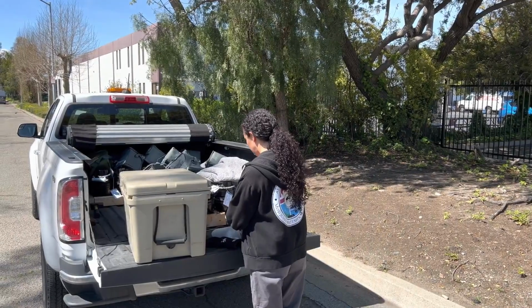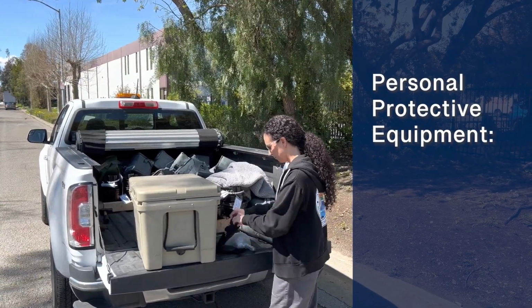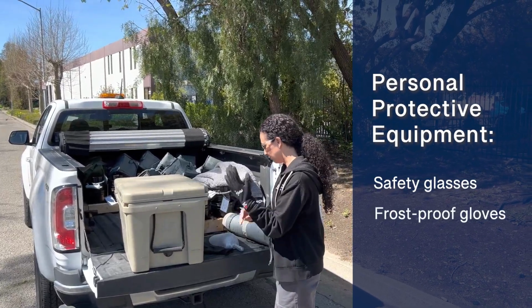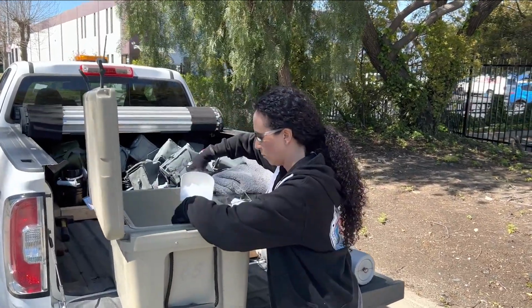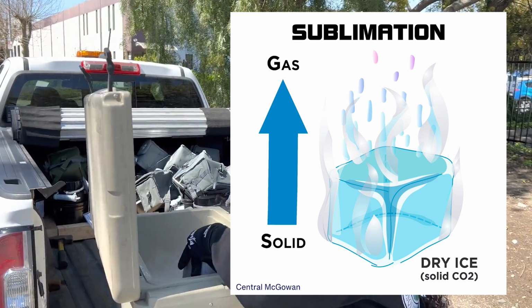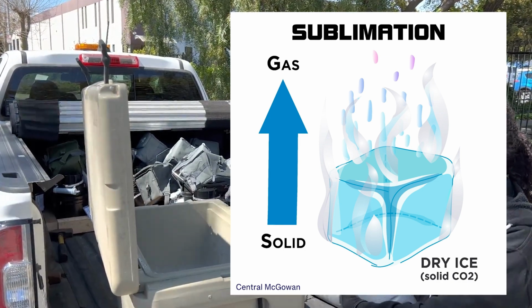When working with dry ice, it's important to don your personal protective equipment, or PPE. This includes safety glasses and frost-proof gloves. We begin by filling our insulated containers with dry ice. Dry ice is solid carbon dioxide that sublimes to produce the gaseous CO2 that attracts host-seeking female mosquitoes.